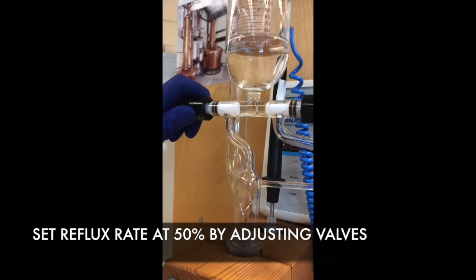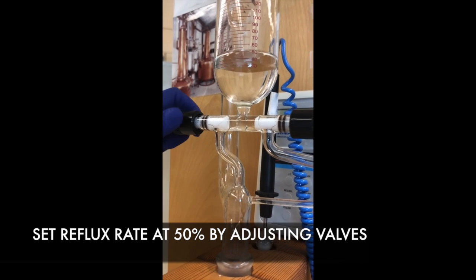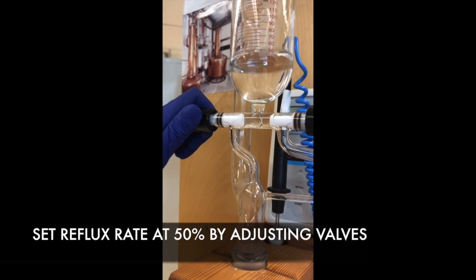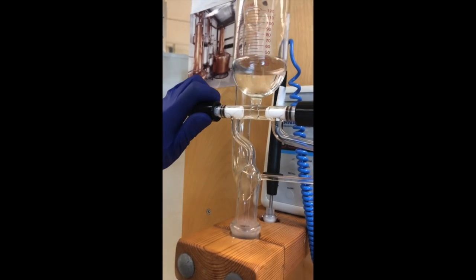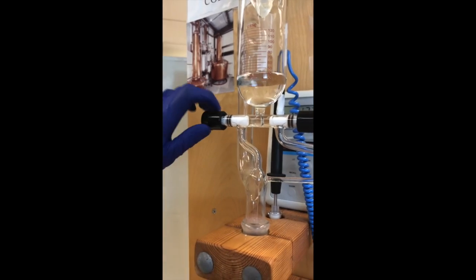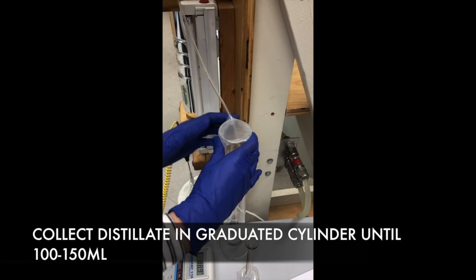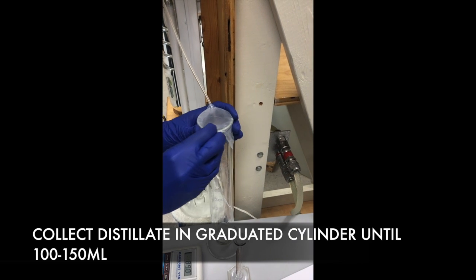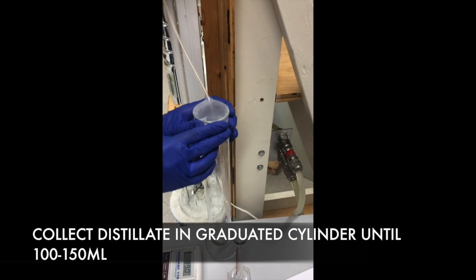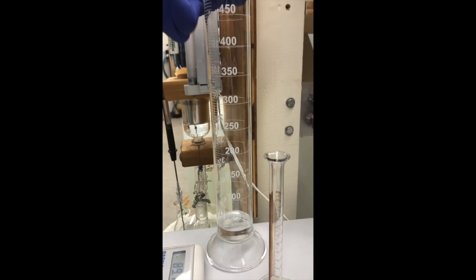One of the key aspects of this lab is looking at the flow rate of the vapor through the column. To carry this out, we'll set the reflux ratio at 50% by opening the valve on the left and using the valve on the right to adjust the flow rate until we have what we want. At this point, the distillate rate should be about half of the boil-up rate. In order to measure this, we'll collect the distillate in a graduated cylinder and measure volume with time every 5 minutes until we have about 100 to 150 milliliters of the distillate. We'll also be taking temperature readings at the top and bottom in 1-minute intervals.